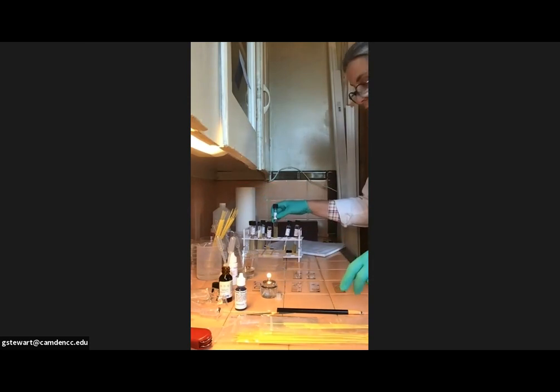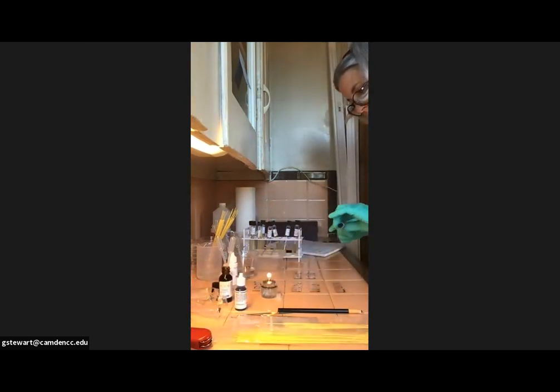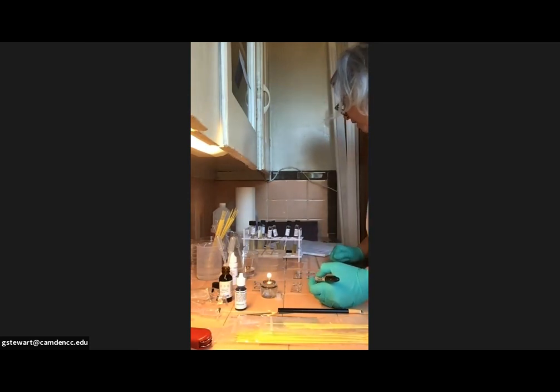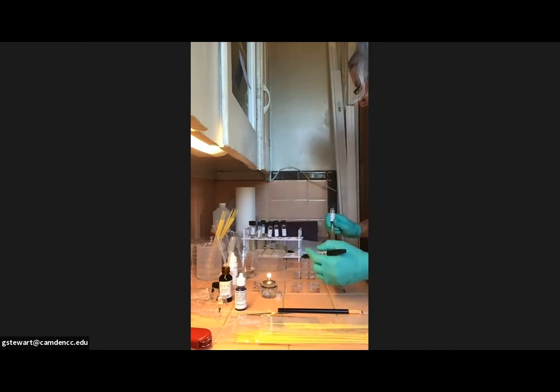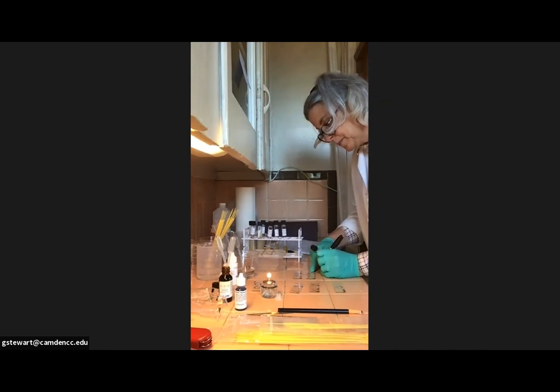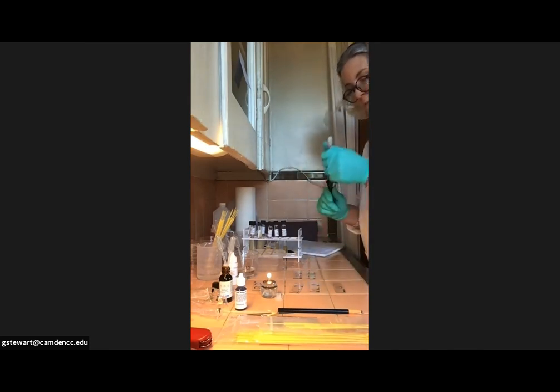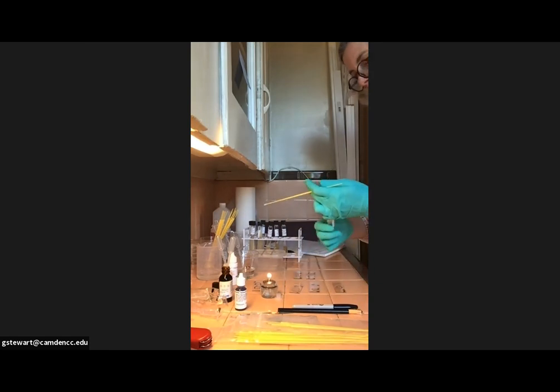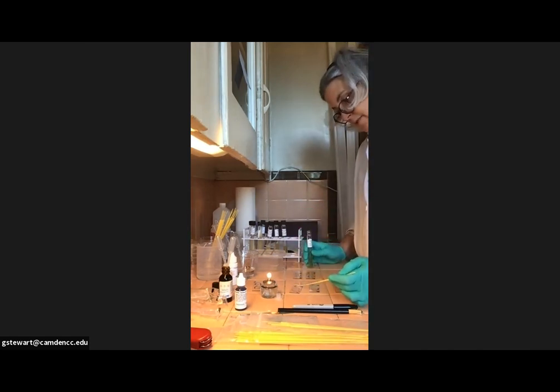I think it would be wise of you to label these with the initials of the bacteria underneath. So I'm going to put EC under both of those. And then I'm going to put my Staphylococcus epidermidis on 2 slides as well in the B position. My slide 1 Staph epi B and my slide 2 Staph epi B. So I'll use fewer loops this way. So I removed a loop aseptically, flamed the top, and I'm going to grab some Staph epi B, put that there, and another loop full for slide 2B.